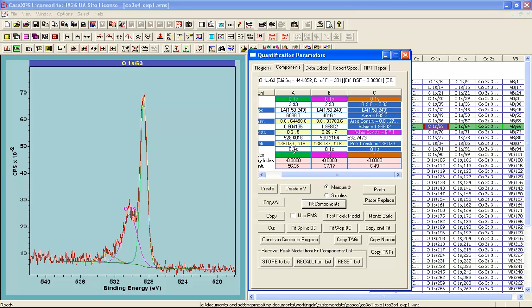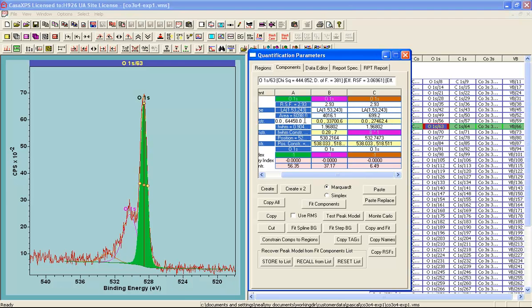And using this as my model, the objective is to have this peak here stable within the peak model. So I'm going to link all of these components. If I say lock, that's locking the area. Into the full width half maximum and say lock. I've locked the full width half maximum. And then the position, I'll say lock again. So this will be my attempt at fixing a position for this first component in this peak model.